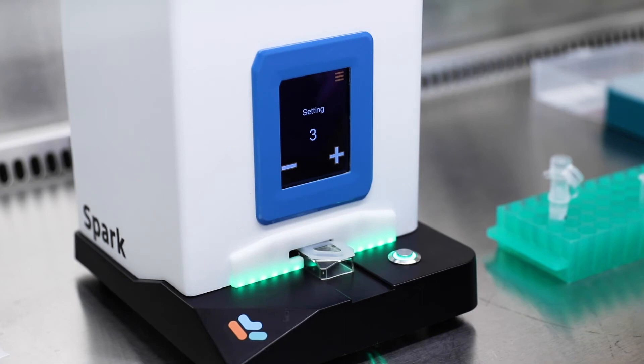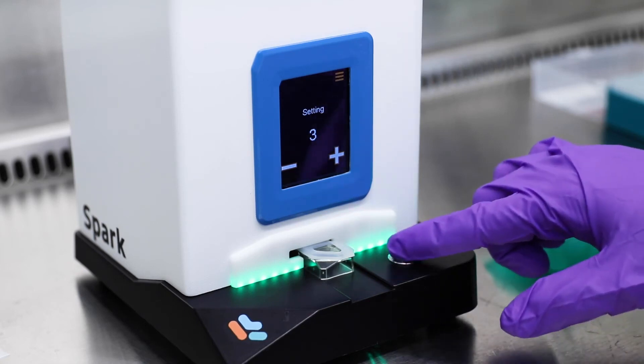If you are in Formulation Mode, select the appropriate setting based on the formulation volume. Here we'll be using setting 3. Now press the Start button.